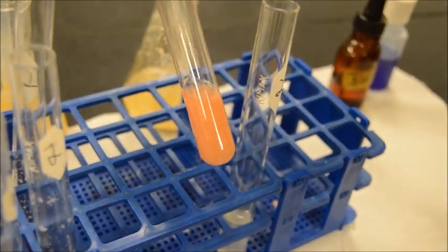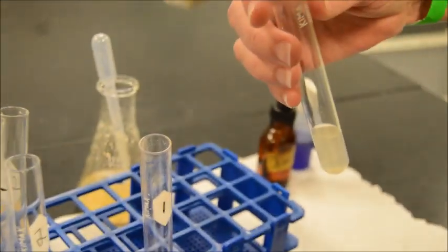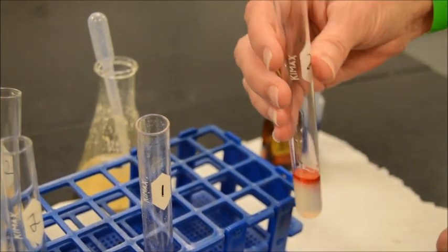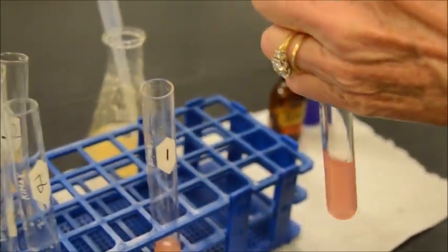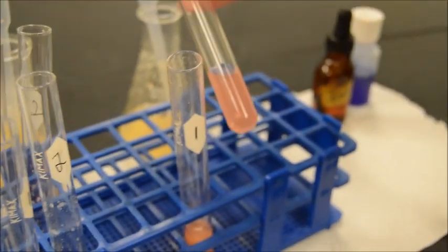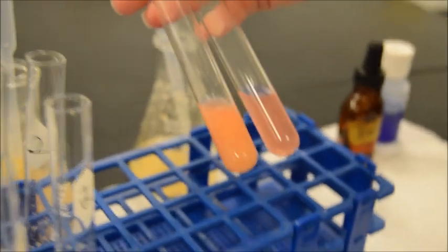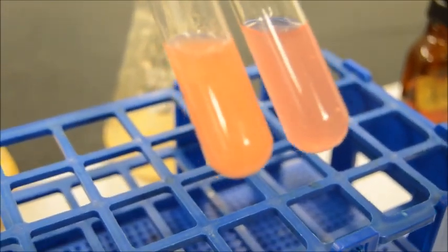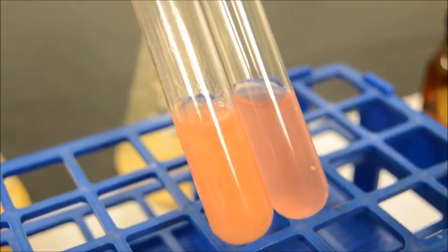So I tell you what we could do is run the next one. Let that one sit. Okay, let's shake this one up good. All right, so we're going to let these sit for a little while, and then we'll come back to you after a few minutes and see if we have any good layering. But if you look at them as they sit right now, we have a nice, even, kind of pinkish color. Would you agree with that? Pinkish. And we'll come back in a few minutes once they've had time to sit and rest and see if we have any layering.